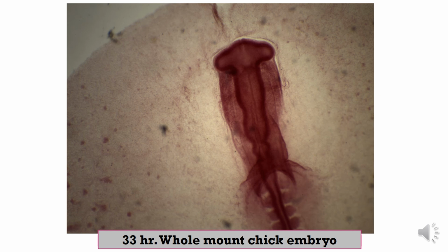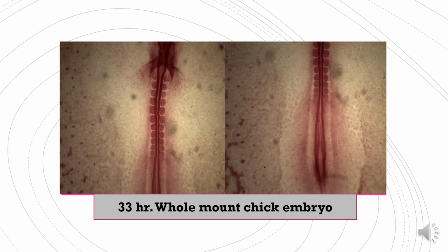And this is the notochord. And this is the somite. Caudally, you can see this is the primitive streak, and at the anterior end of the primitive streak is the primitive pit, and a dark region surrounding the primitive pit is called the primitive knot.